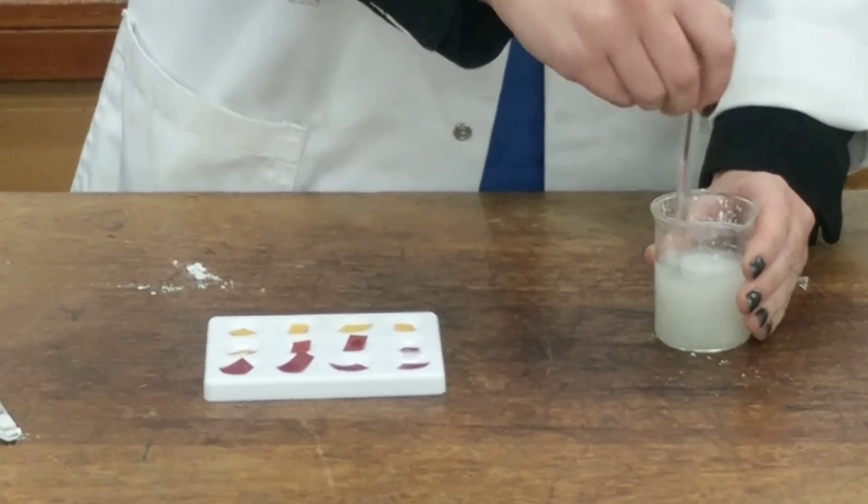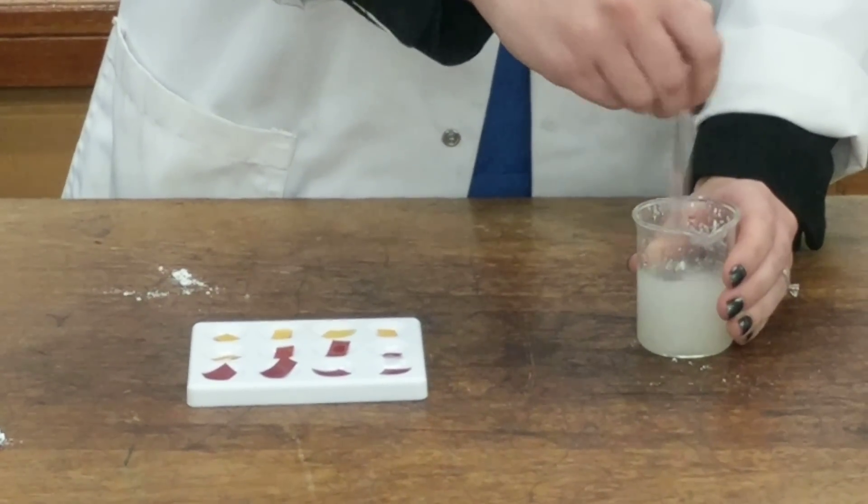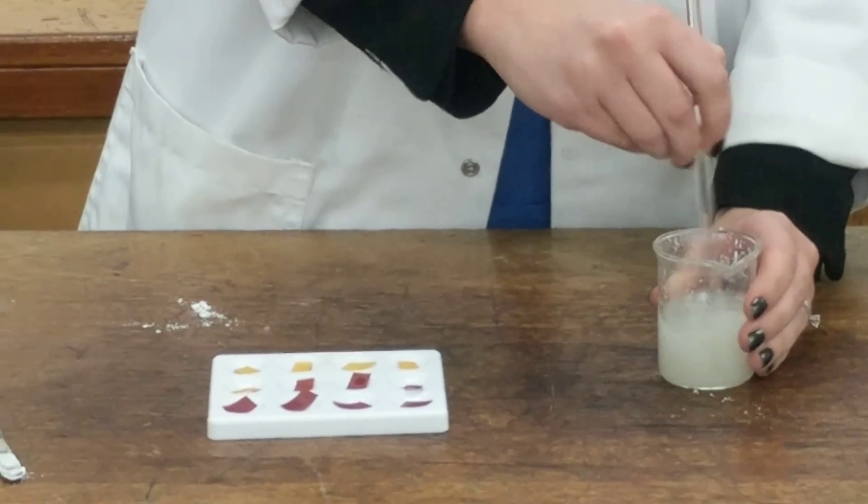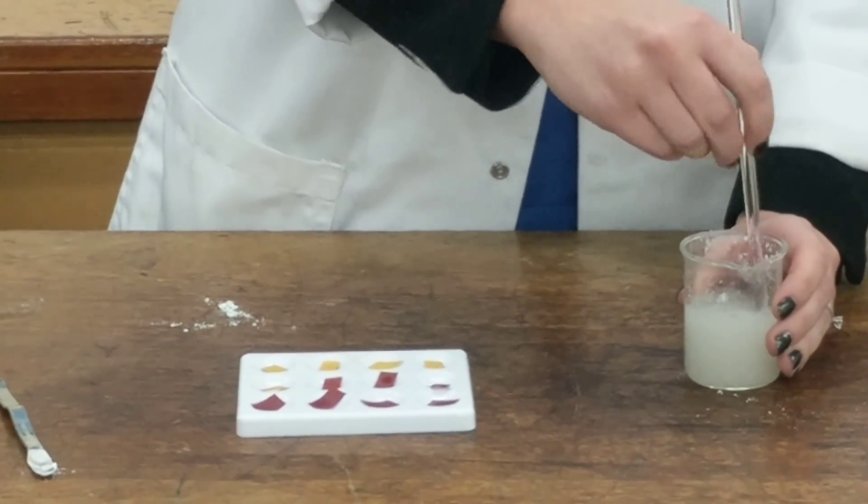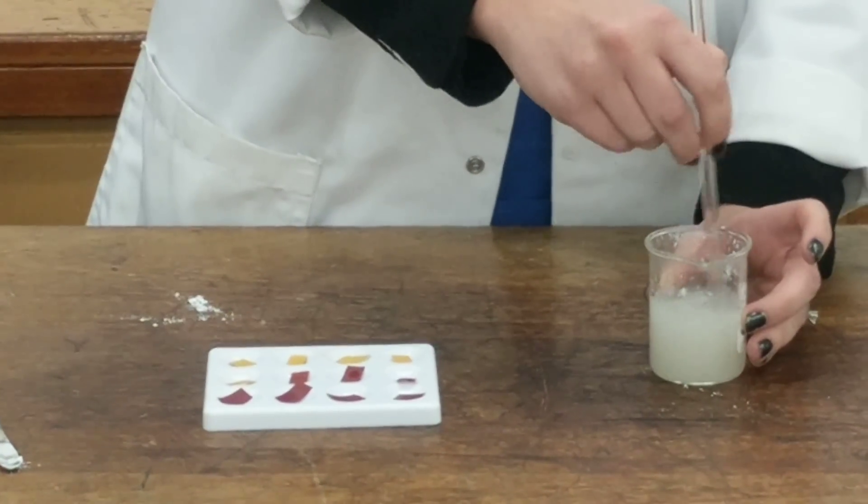It's important to think about safety. Using hydrochloric acid, it is corrosive, so if it does spill onto your hands, it's important that you wash it off straight away. Alternatively, you could use gloves.